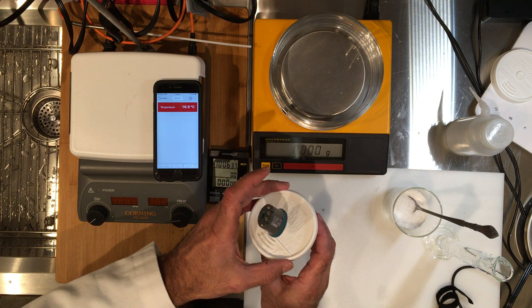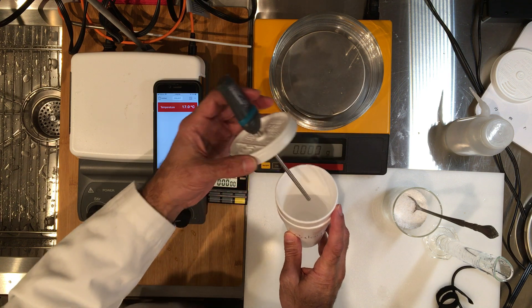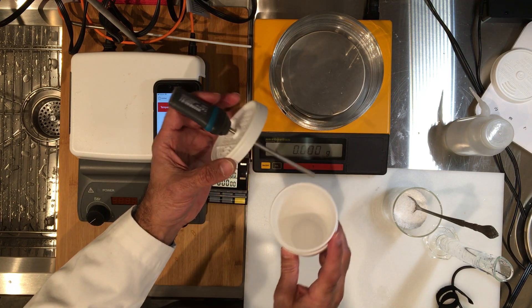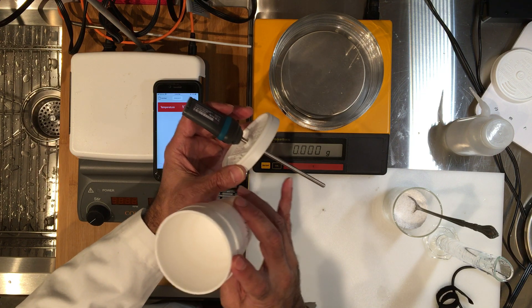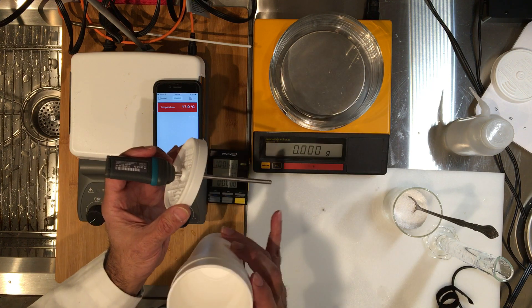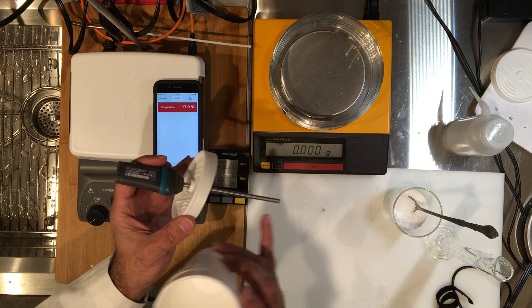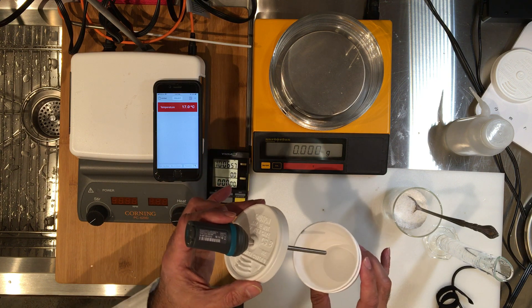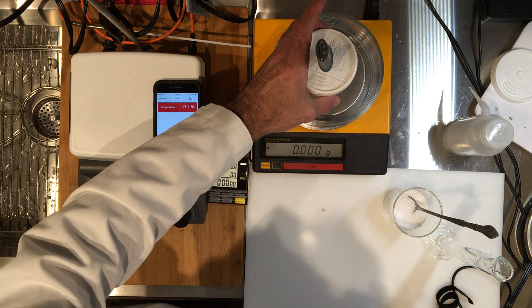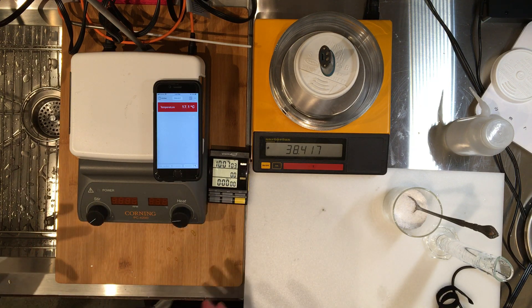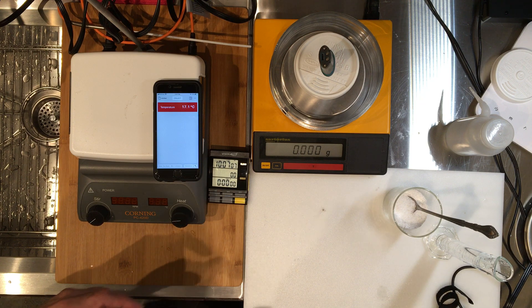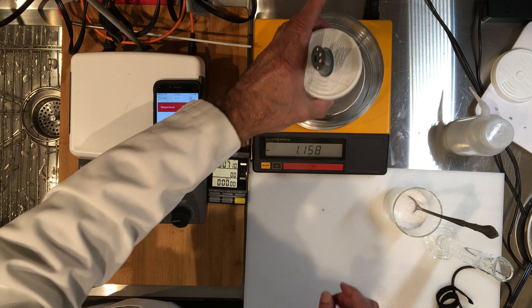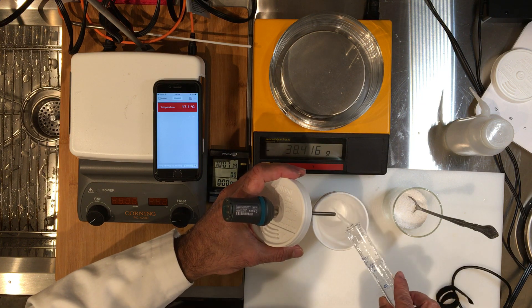Now I'm going to measure the mass of this calorimeter with the thermometer, because once the reaction is over there would be some liquid stuck to this metal part here. If I take this off and then measure the mass, you're going to lose out the mass of that portion of whatever that liquid solution weighs. So let's go ahead and do it together. I'm going to measure this mass, but the idea is to measure the mass of solution and water. I'm going to zero the mass of the scale and then I'm going to pour in my 50 milliliters of water.